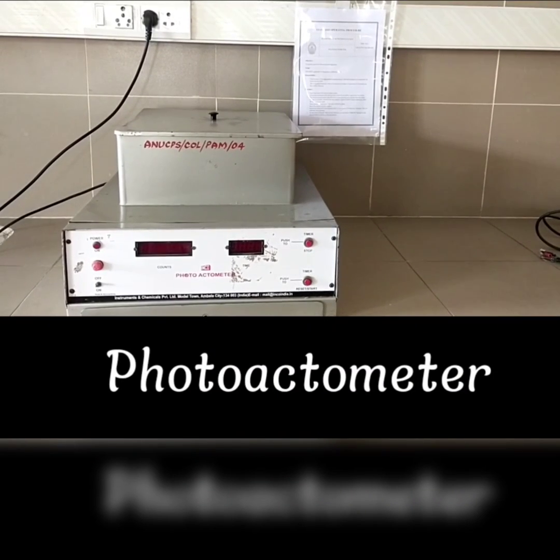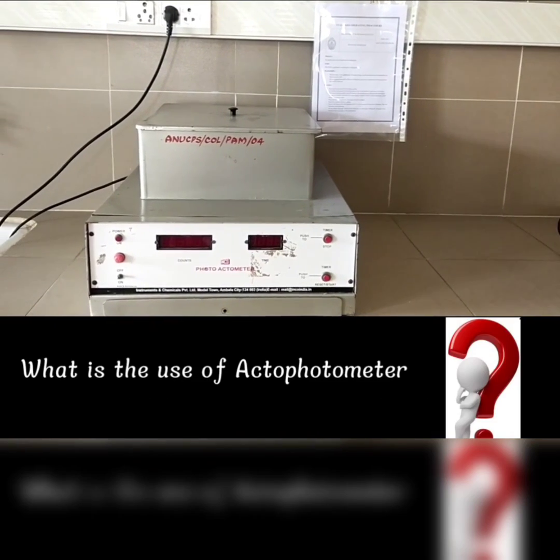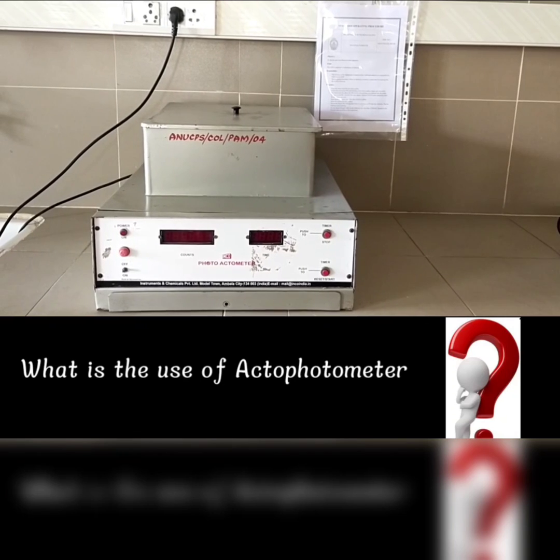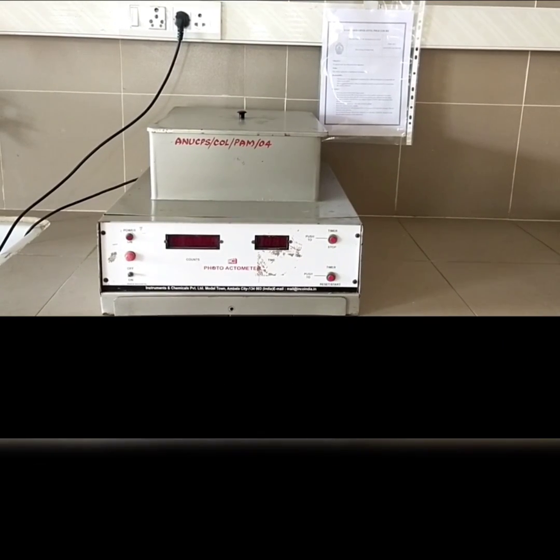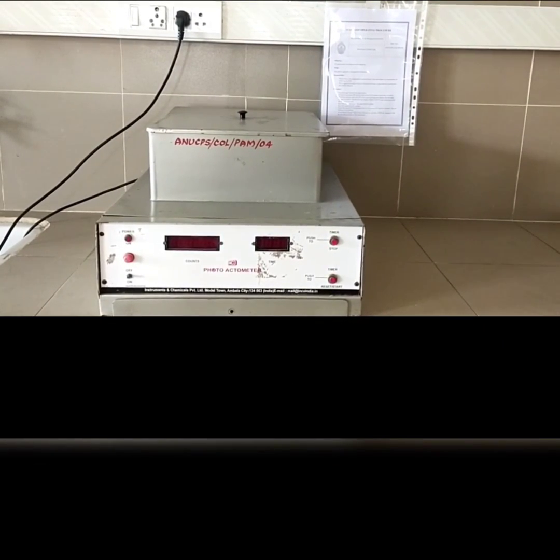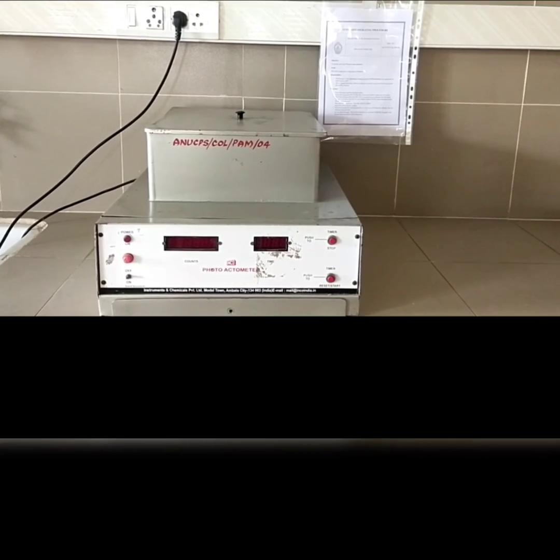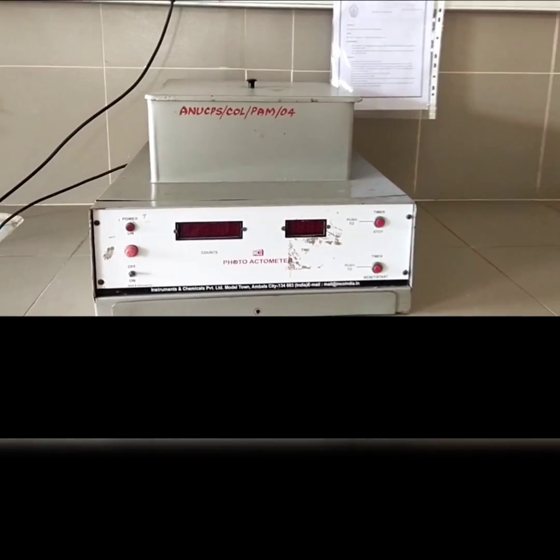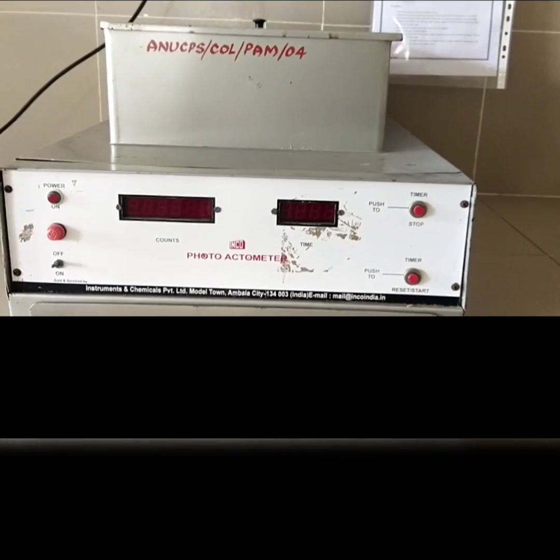Photoactometer or actophotometer — what is the use? The photoactometer is used to study the locomotory activity of small animals such as rats and mice by evaluating the effects of drugs on the central nervous system.